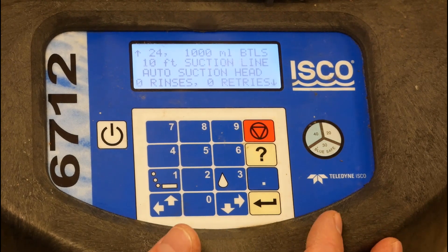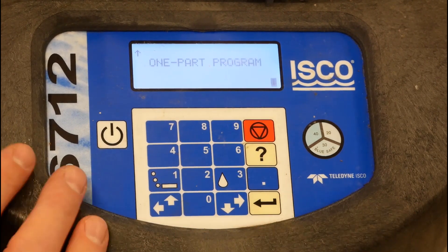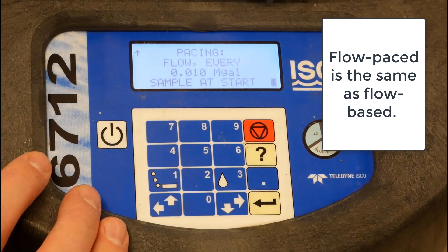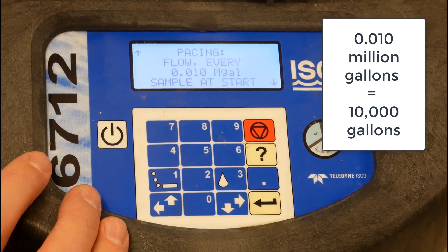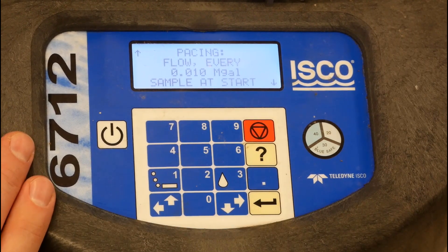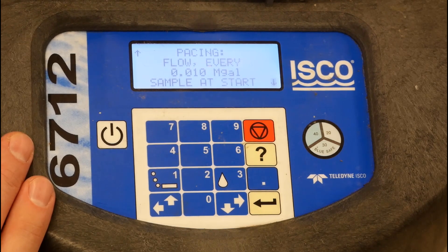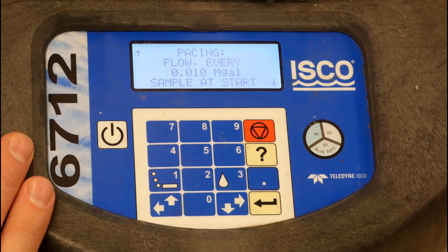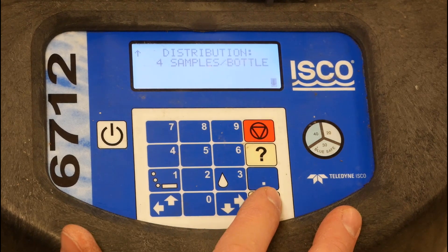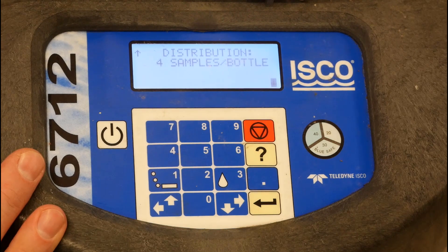The program is going to automatically calculate the head — how hard it's pulling the water. We're using a simple one-part program and we're going to base everything on how much flow goes through that V-notch weir. We're going to take a sample every 10,000 gallons, or 0.01 million gallons. This is flow-based sampling, and every 10,000 gallons we will take one sample. We're going to start sampling when we start the program. We have this set up to take four samples and put each of those four samples into the same bottle, so this is a composite sample, not a discrete sample.